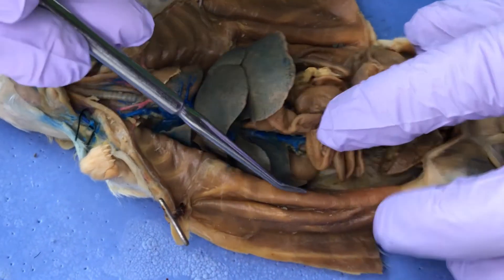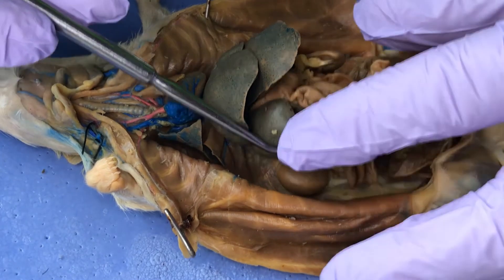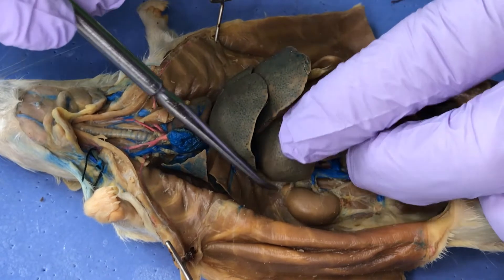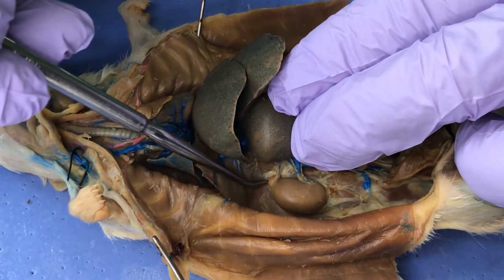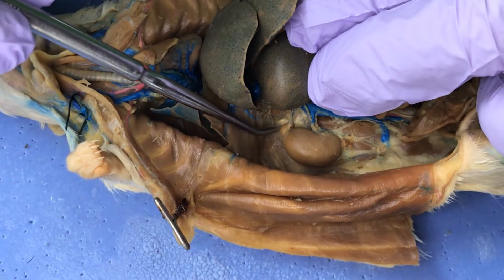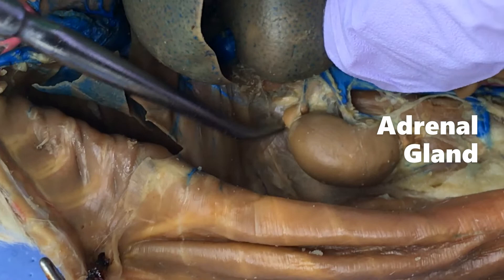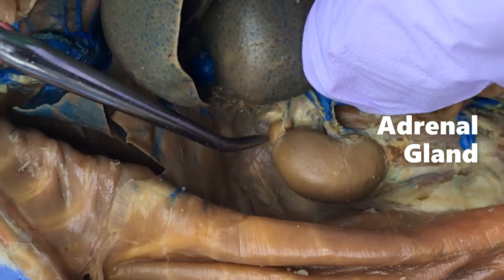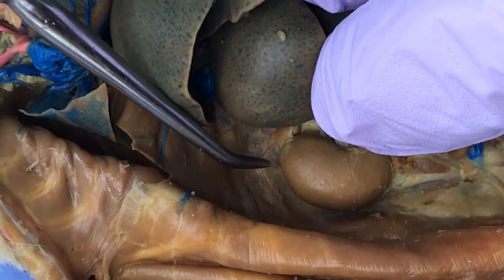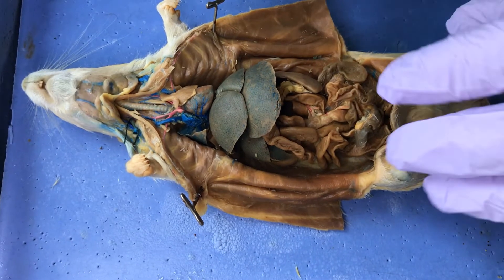Moving to the right kidney over here, just because it's closer to the camera — I'm flipping up some more liver and moving stuff out of the way. Here's a kidney, but at the top of the kidney is what I'm trying to look at. At the cranial end under the kidney, you see this little white dot, another little white lump — that is your adrenal gland, or the rat's adrenal gland. The adrenal gland produces a number of hormones, which will be detailed in a later video.